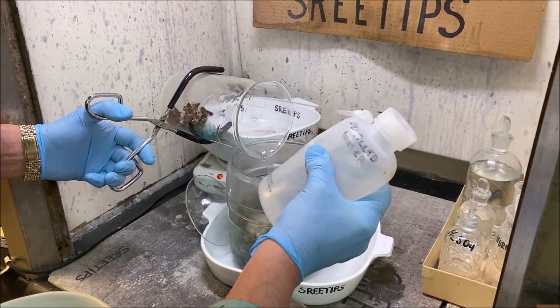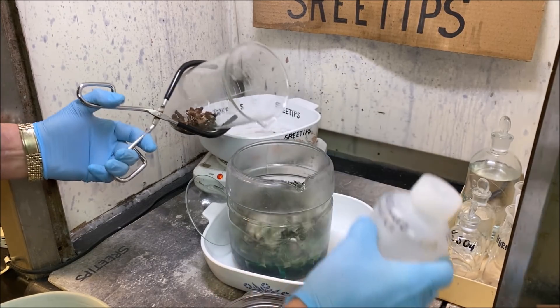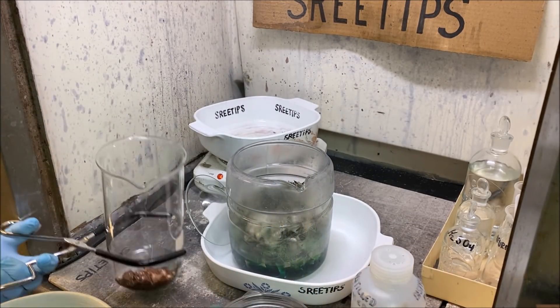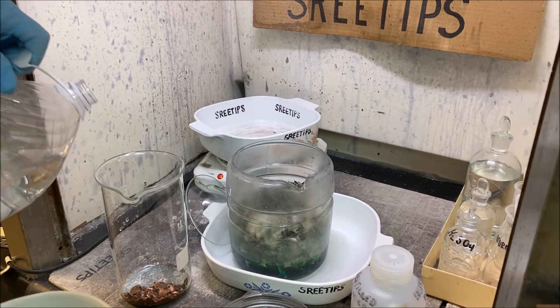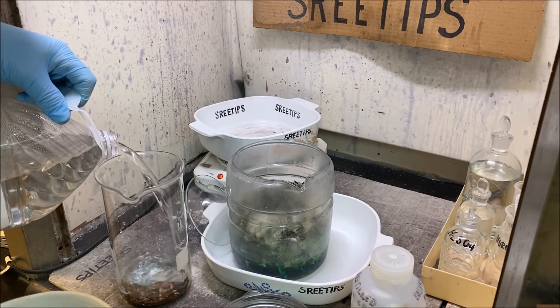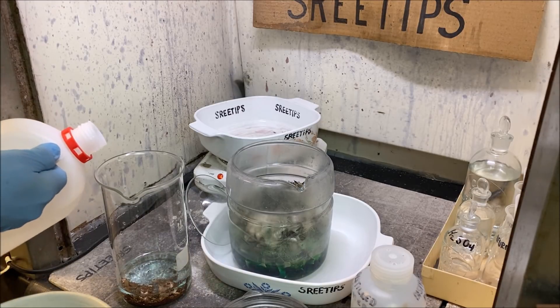We've got most of that blue liquid rinsed off. If a little bit of gold goes over into the silver jar, that's okay. Now I'll add some distilled water and some more nitric acid and put it back up on the heat.